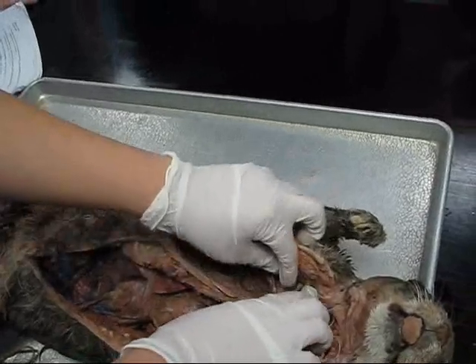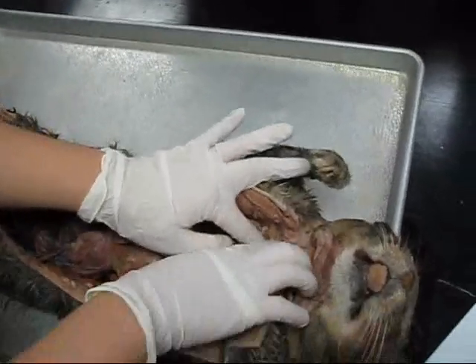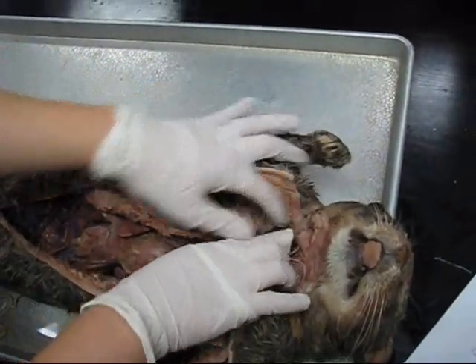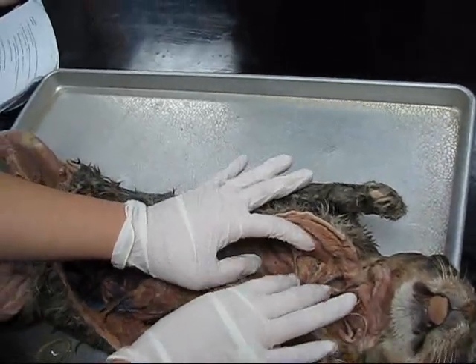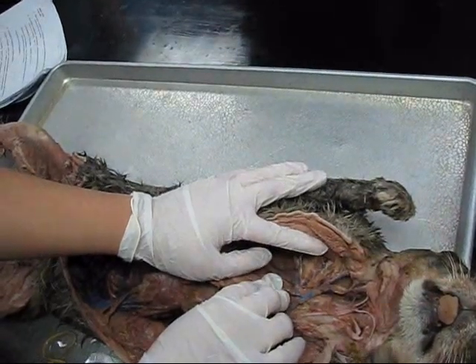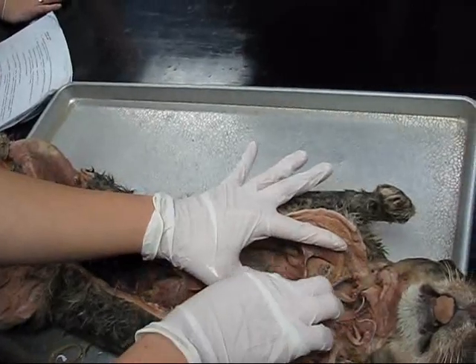The jugulars come up through here. You can see it's going to go up through the neck. And then you have where it branches off here to go to the arm — the subclavian, which is the first part. The subclavian would be coming off here.